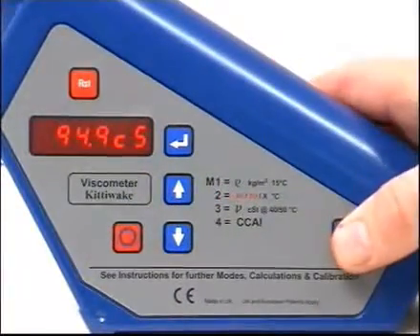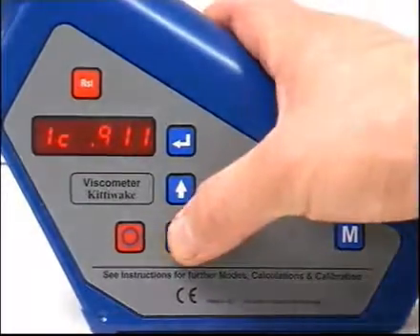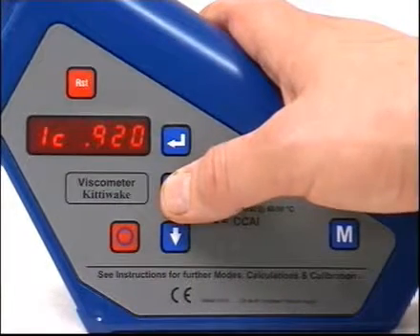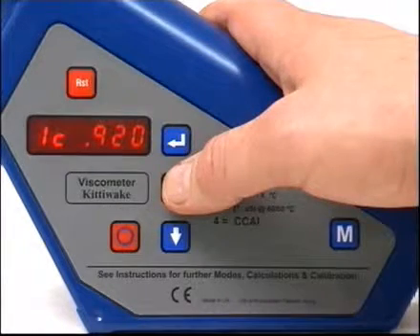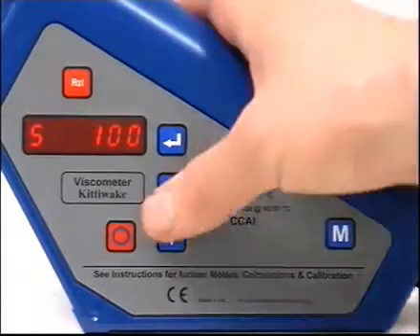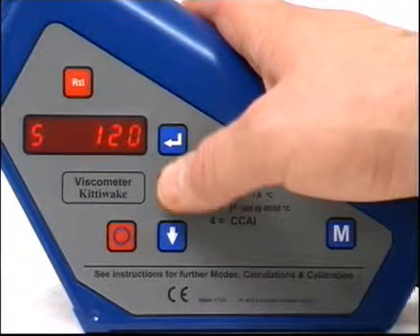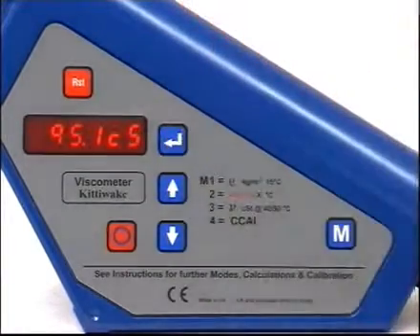For unheated operation with multigrade or synthetic oils, follow the basic procedure for readings at 40 degrees. Then select Mode 1 and enter the figure for corrected oil density — the default setting used is 0.9. Select Mode 5 and enter the viscosity index figure; the default here is 100. Press Return to recalculate centistokes at 40 degrees Celsius.